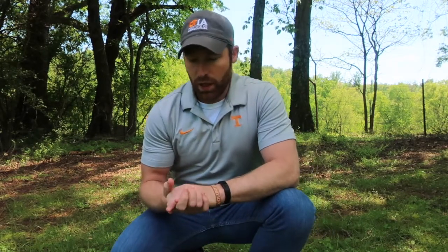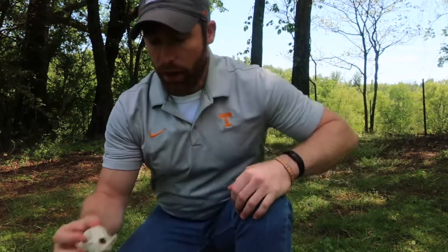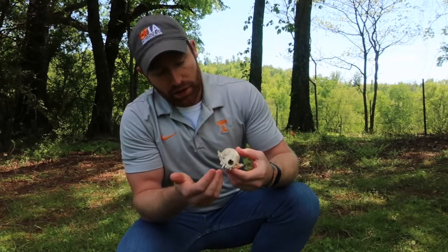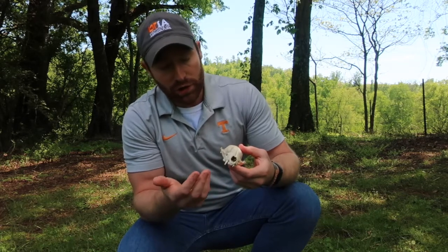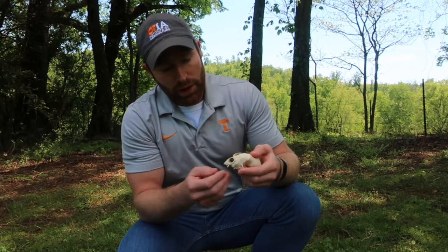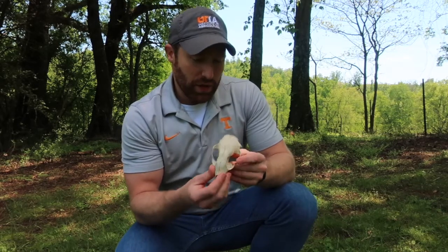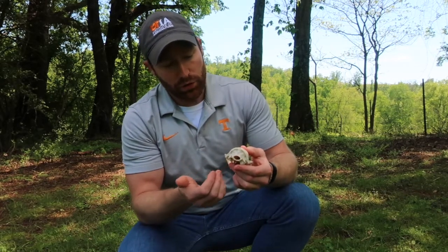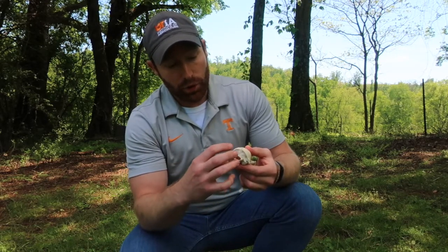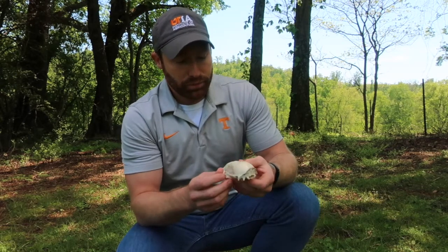our calf dissection. I'll show you a couple of skeletons that we have here. This first one is either a possum or a raccoon skull, and I want to show you this because you can see that the canines on the front are much like Charlie's. They're more for tearing their food before swallowing, and they have some upper incisors in the front. Something also interesting about these skulls is the very large opening in the back, which is called the foramen magnum, and that's an entrance for the spinal cord to enter into the brainstem, and then into the brain or the skull of the animal.